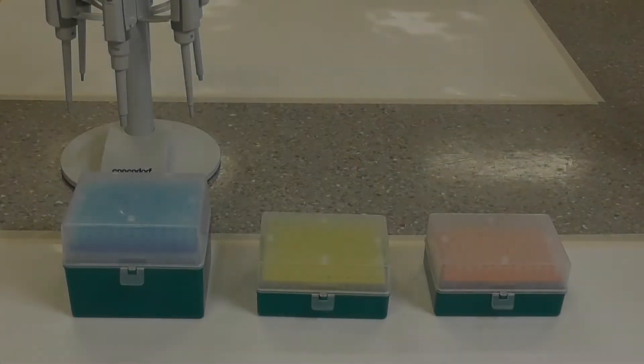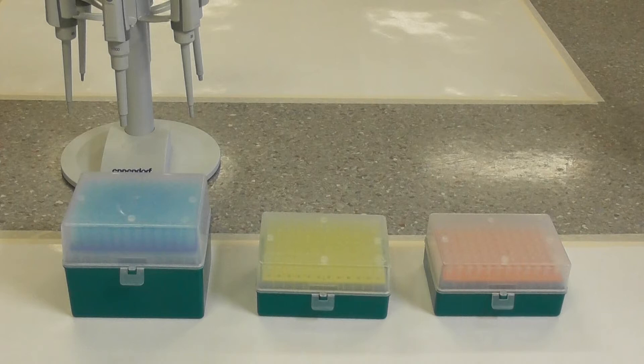The different sized pipettes require different sized disposable pipette tips. In the lab you may be presented with any of these three boxes of pipette tips.